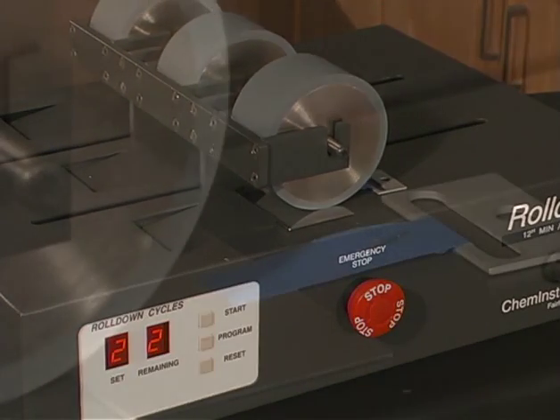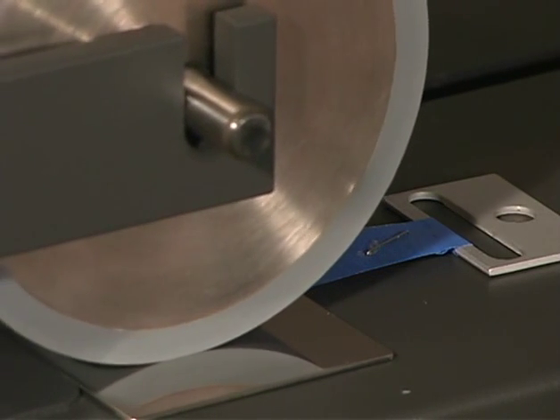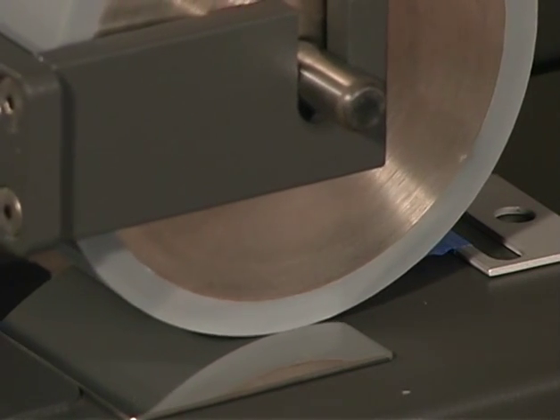Also make sure the roll down is accomplished twice in each lengthwise direction to the very edge of the sample, but no more, so that the sample is not creased over the edge of the panel.